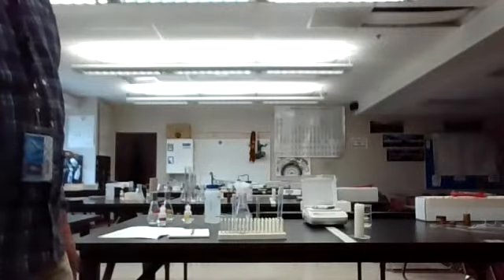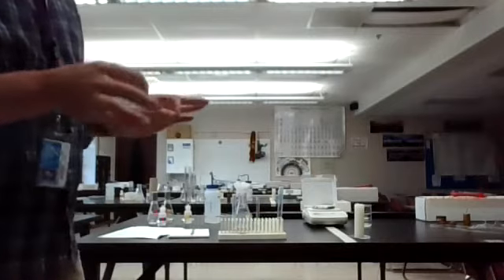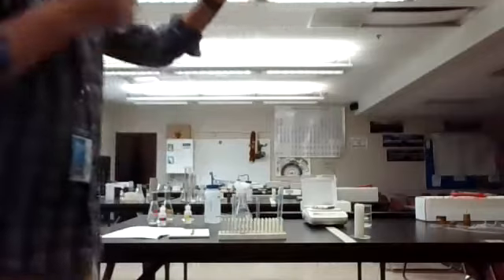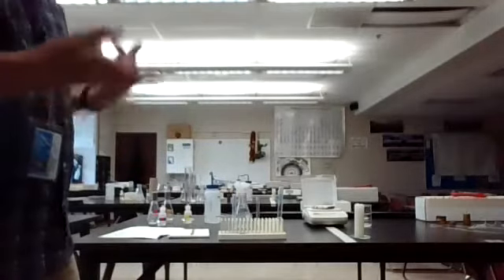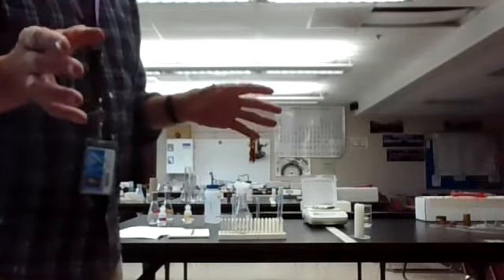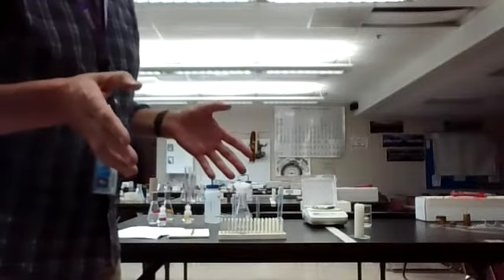Notice though that we had smoke coming out of the candle at the end. Okay, you can have chemical changes and physical changes happening at the same time. So there was a little bit of physical change happening too, but the main thing we were looking for was a chemical change. Chemical changes generally have something happening in almost all of them. Atoms are rearranged. That's the definition of a chemical change.